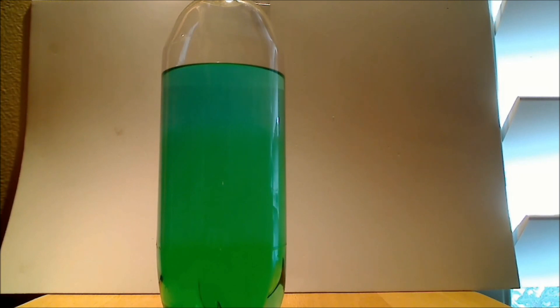Okay, you can see we're starting to get a separation. It looks like the top is becoming a little bit blue, whereas the bottom is more green.